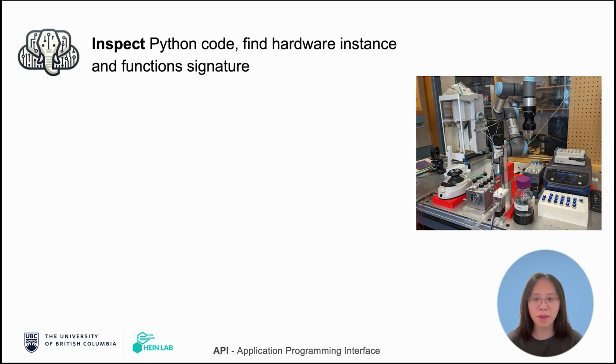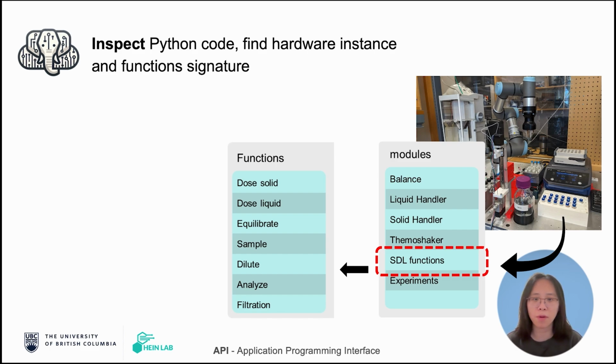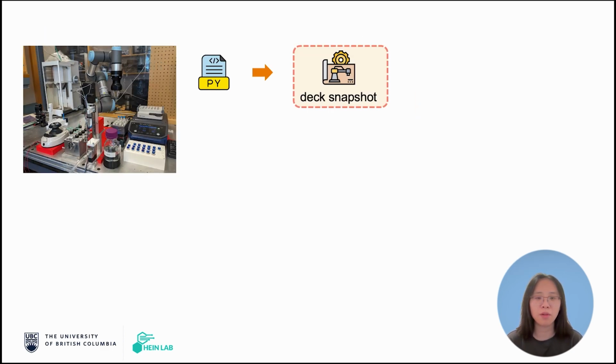To achieve this, we use the Python built-in inspect feature and look into the current SDL Python script. We find all the instances that are related to hardware control. For example, on the current platform, it could be the automated balance or a liquid handler. This could also be the high-level user functions involving multiple devices and the robotic arms. For each hardware control instance, we further look into their class and find the available functions of this hardware. For each function, we look into their parameters to see what kind of parameter types or default values are needed for calling these functions. In the end, we have the platform snapshot, which captures the current state of the SDL system.